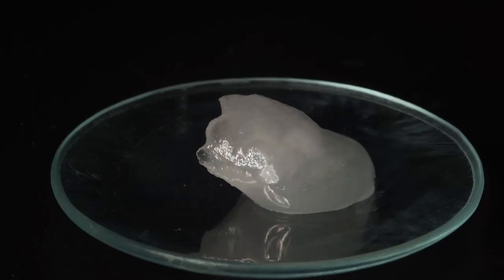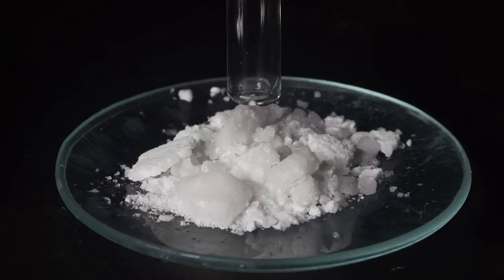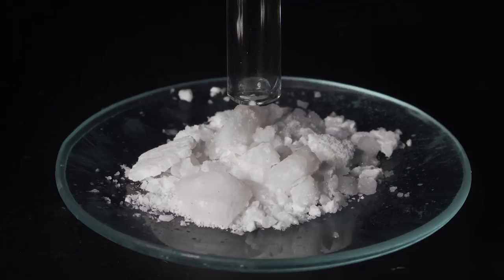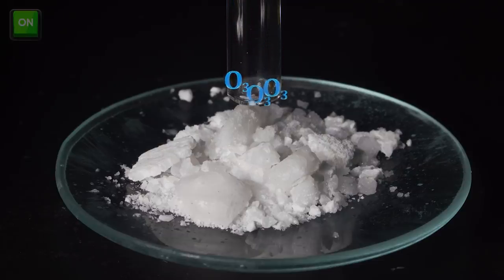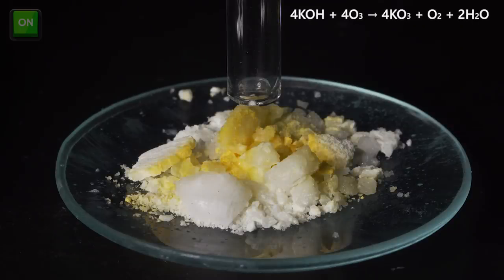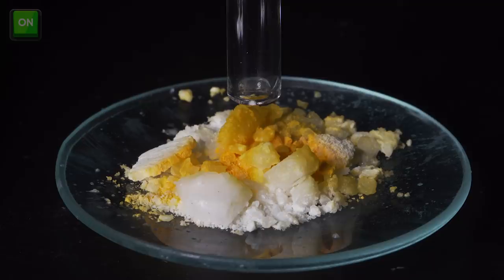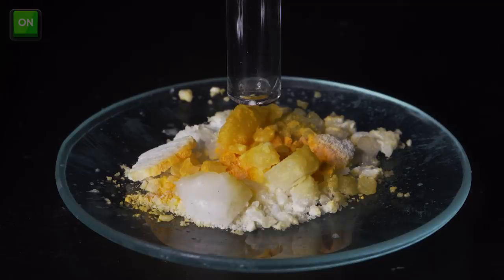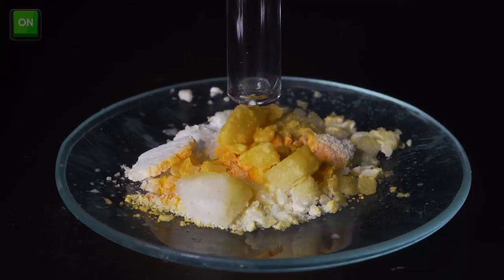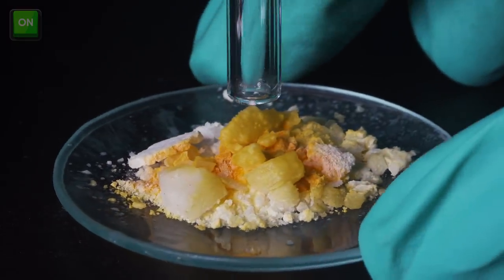This reaction should have been performed in a glass tube, but to make it more vivid, I will perform it on a watch glass. See what happens when I supply ozone through this glass tube — a very thin layer of potassium ozonide is forming on the potassium hydroxide. It is yellow but turns red when the concentration is increased.